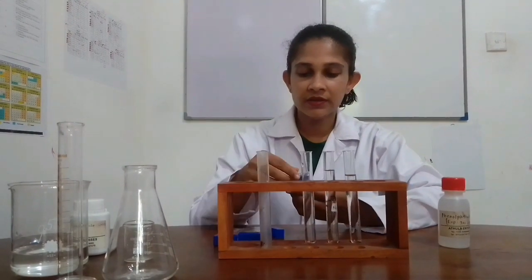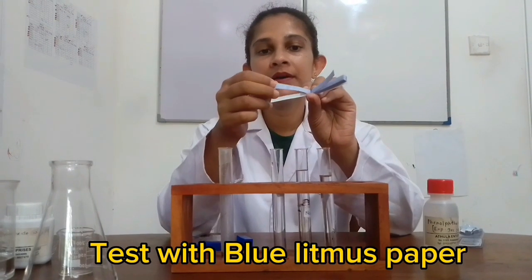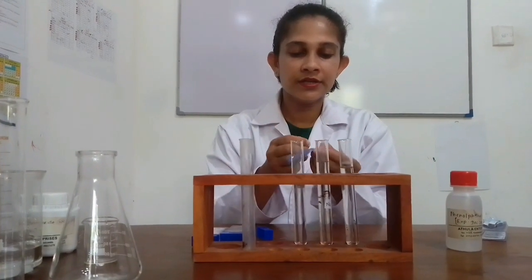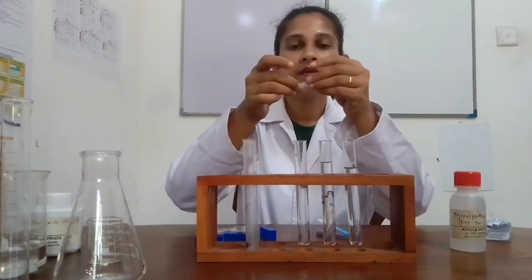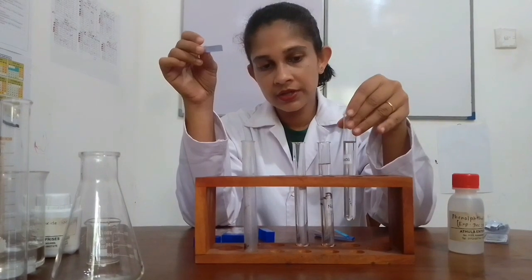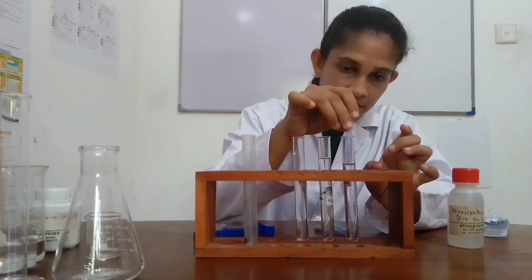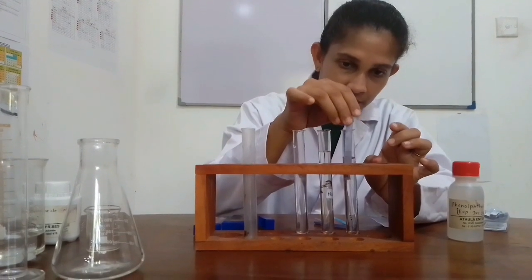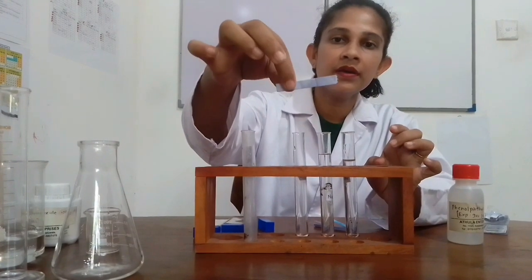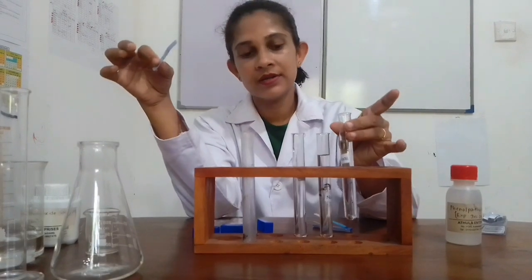First, let's try with blue litmus paper. Let's observe the color of this paper when we check it with each of these solutions. First, I try sodium hydroxide solution.